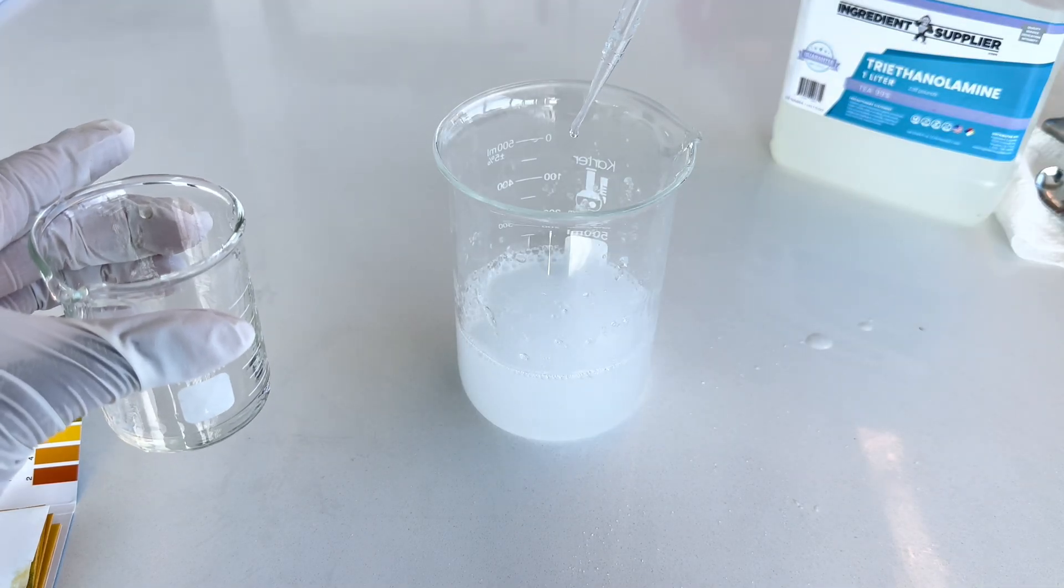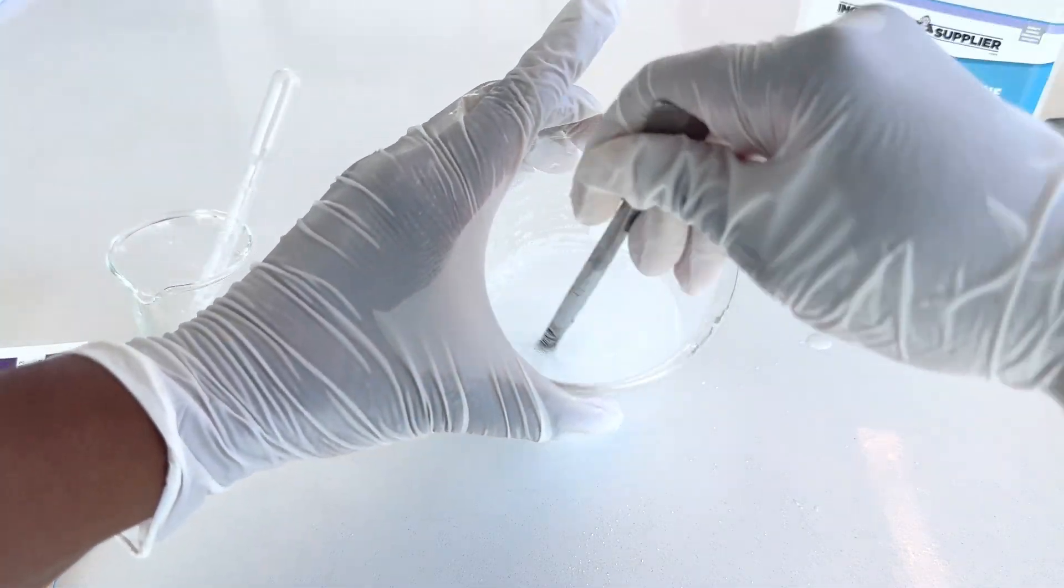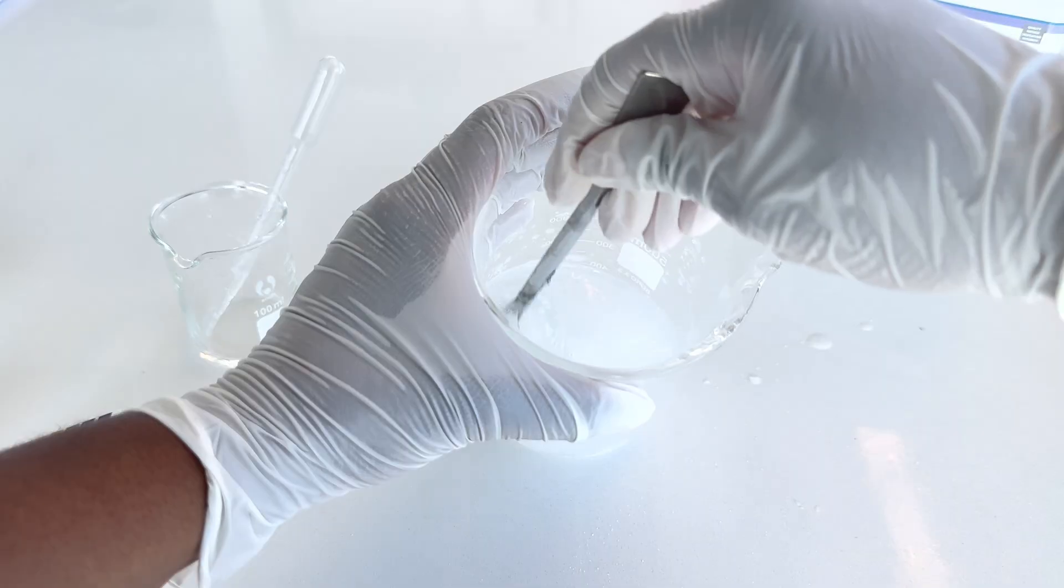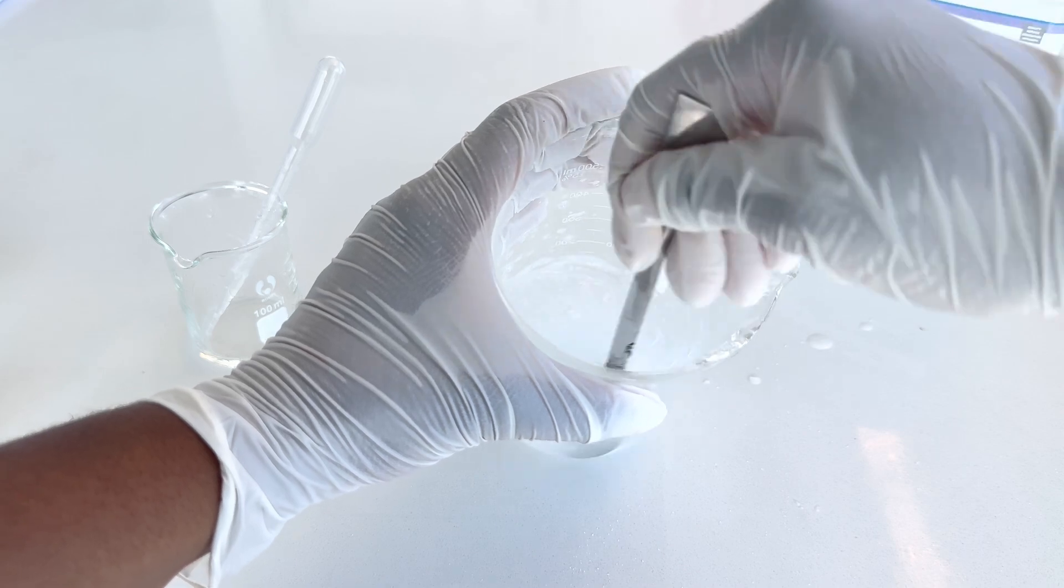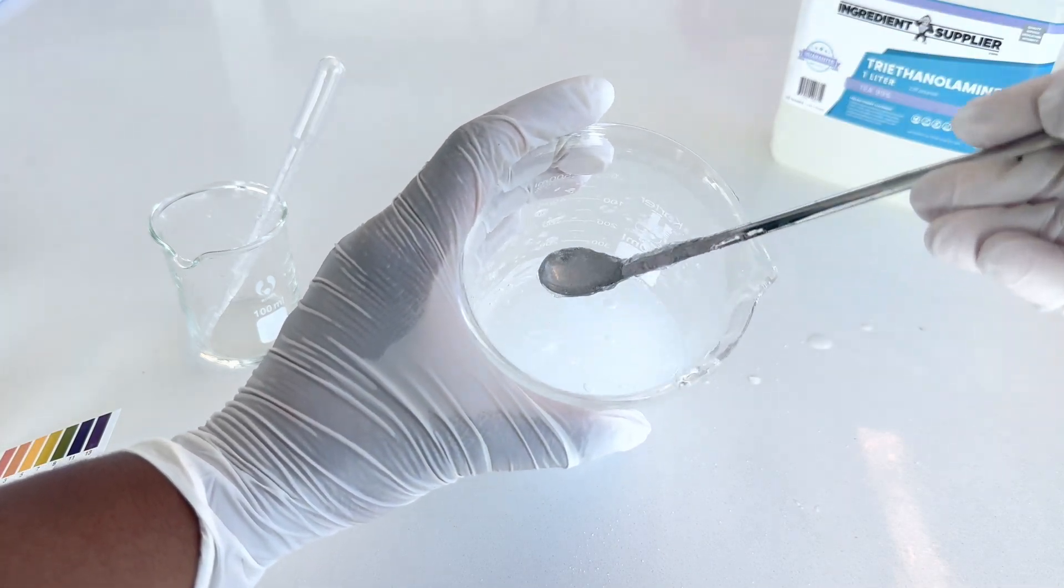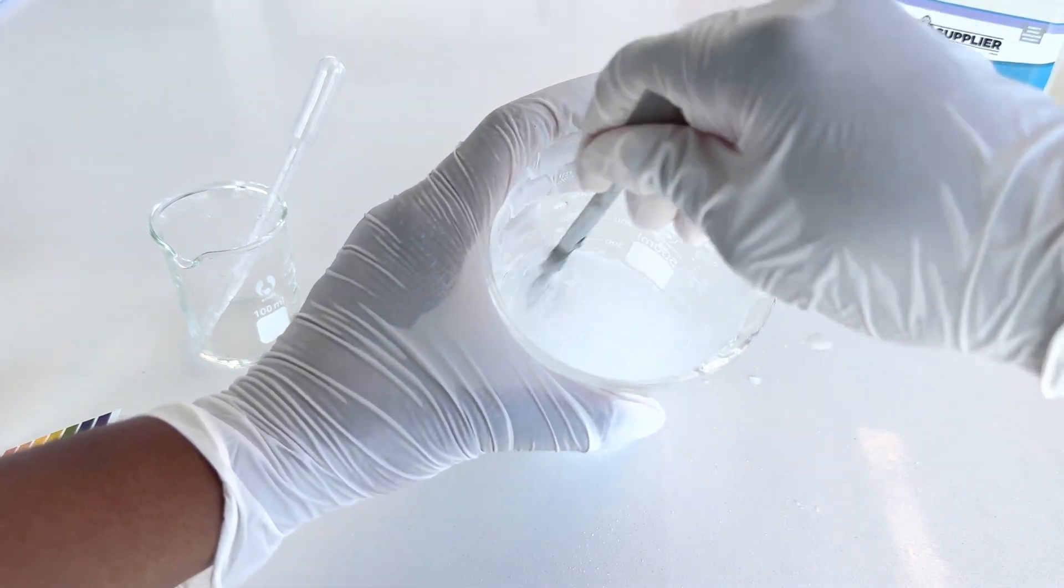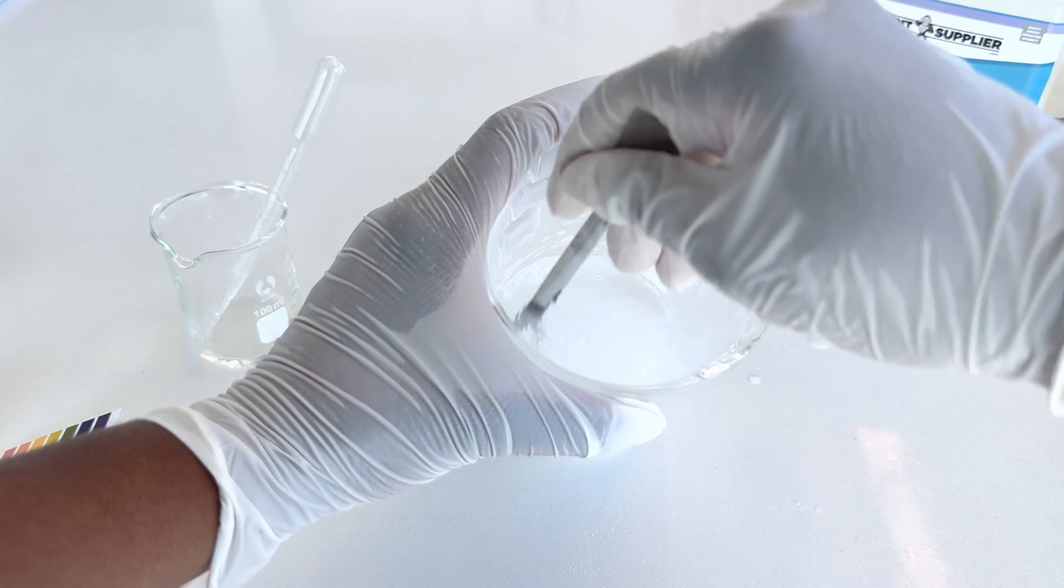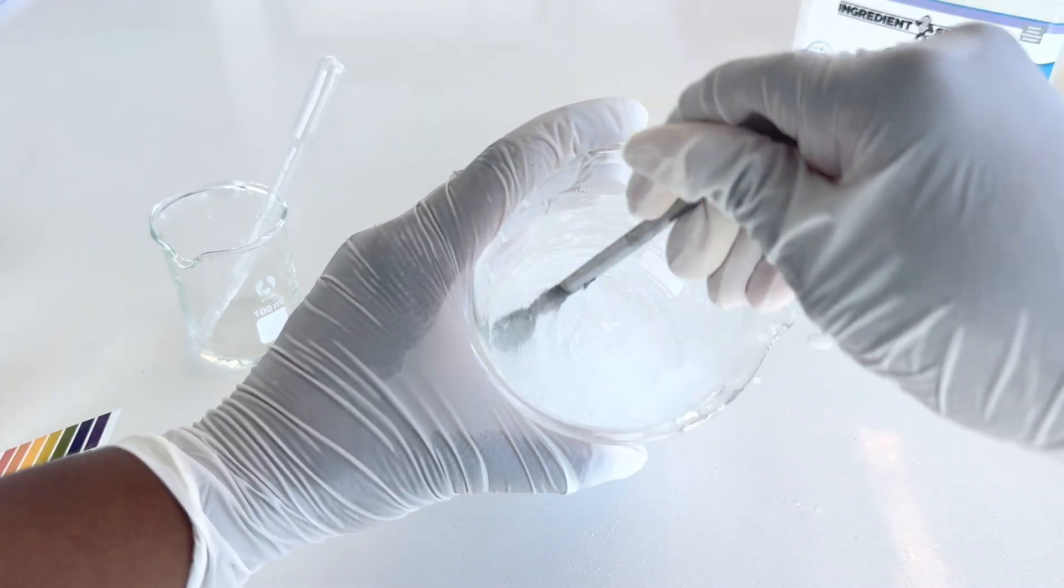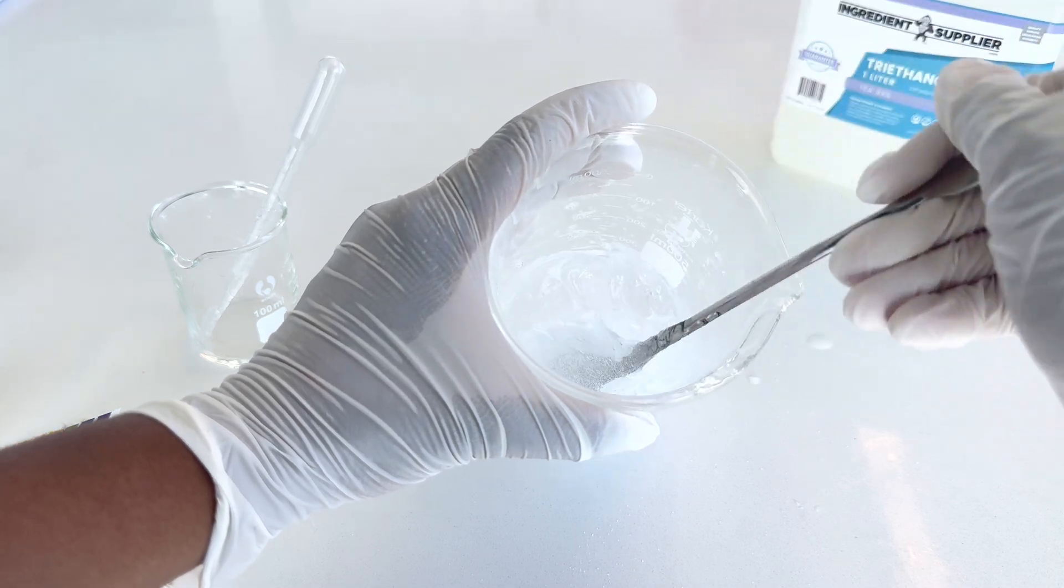I continue mixing thoroughly to incorporate the TEA evenly and allow the gel to thicken.